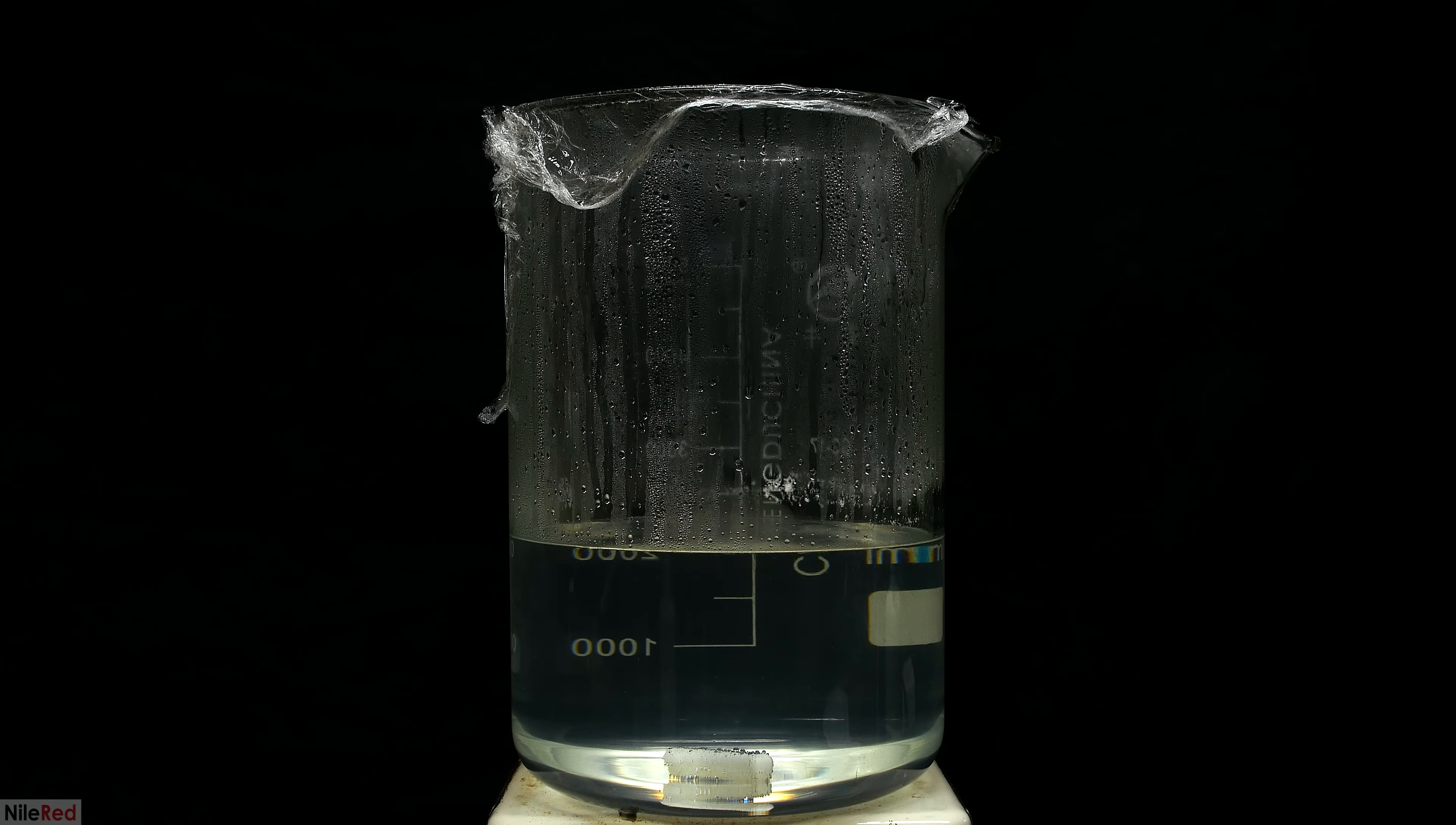Now we just wait for everything to cool down and for our trans-cinnamic acid crystals to form.